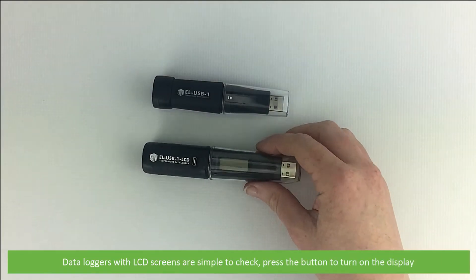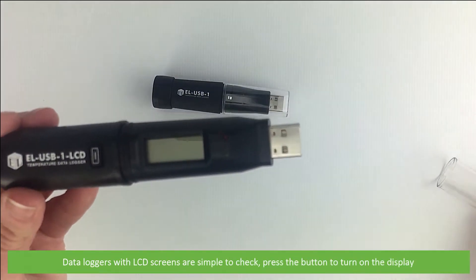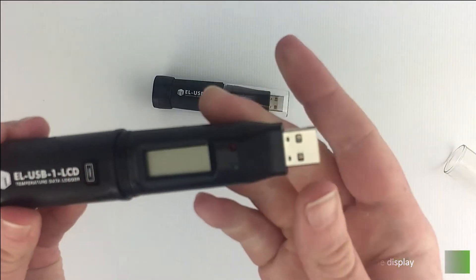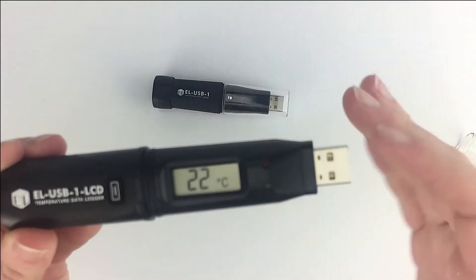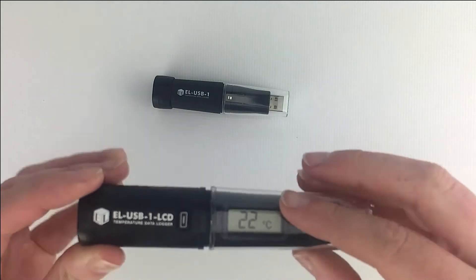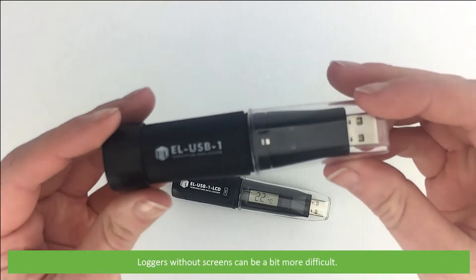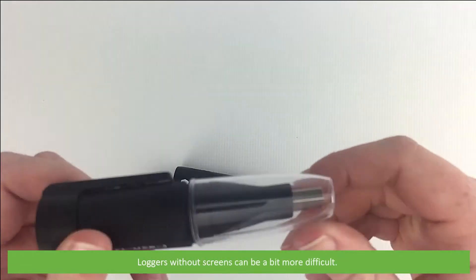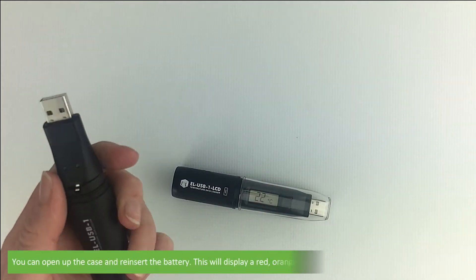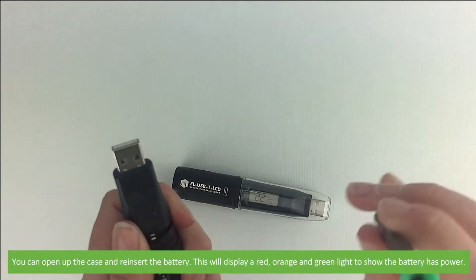For checking the battery, data loggers with LCD screens are quite simple to check — just press the button to turn on the display. Loggers without screens can be a little bit more difficult. One way to check is to open up the case and take out and reinsert the battery.